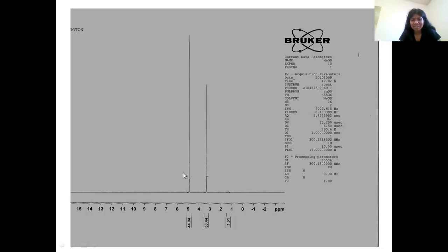One thing that is very interesting I would like to share is that whenever you integrate the compound peaks, and I will show you step by step what characteristic compound NMRs look like, you will get reasonable values like 2, 3, 4, 5, and you can check whether they match your structure. But whenever you integrate the solvent peaks, they will give you absurd values like 45, 53, 110. You should not assign those peaks to your compound. There must be some solvent or impurity.